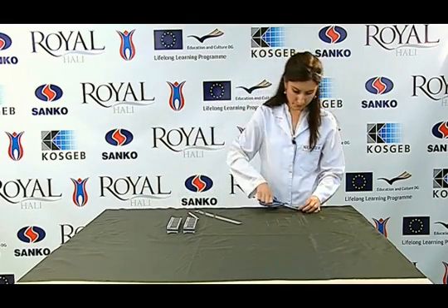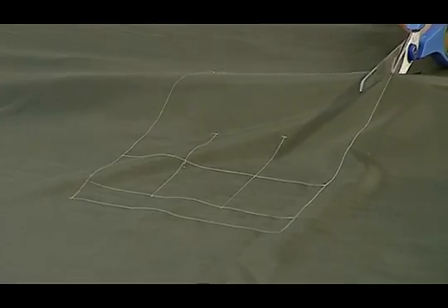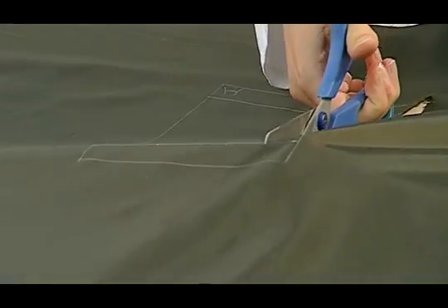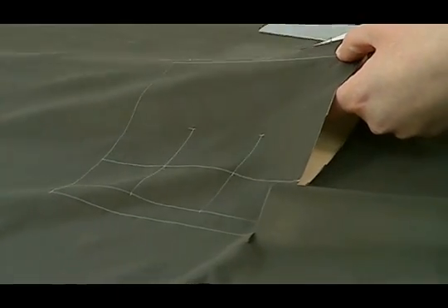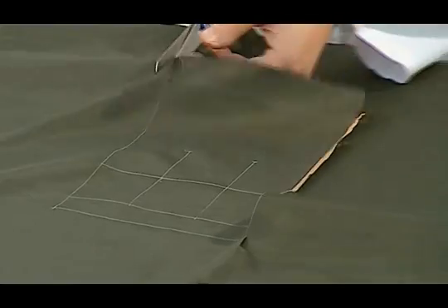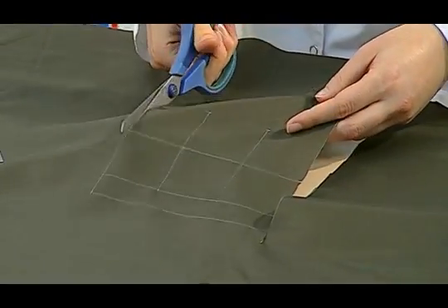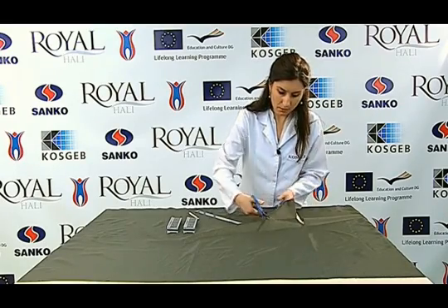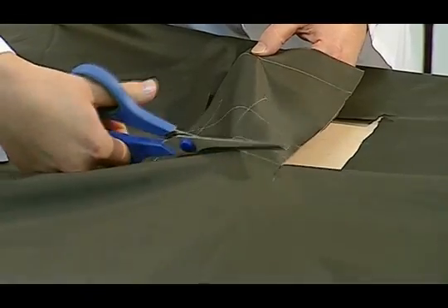Then, using scissors, the sample is cut properly. When drawing the samples, the specimen must be chosen in a way that it does not include the same weft and warp yarn.